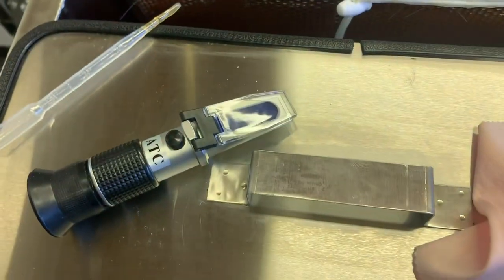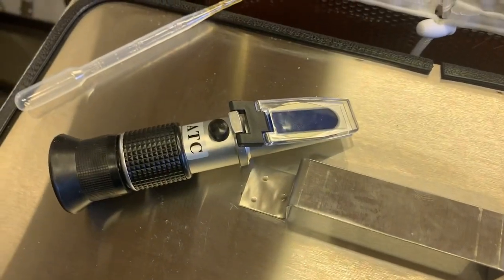You're going to let it settle for a moment to make sure no air bubbles are in the way, and then we're going to take a look inside the refractometer again.